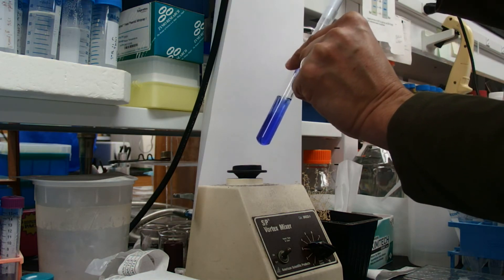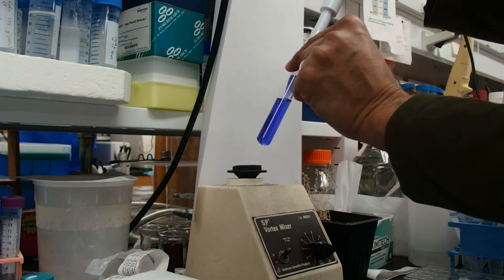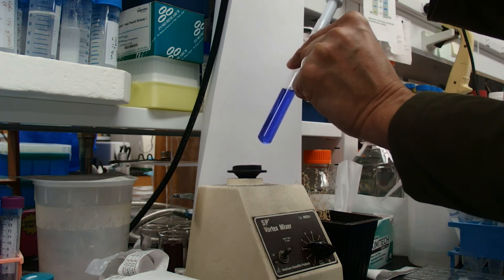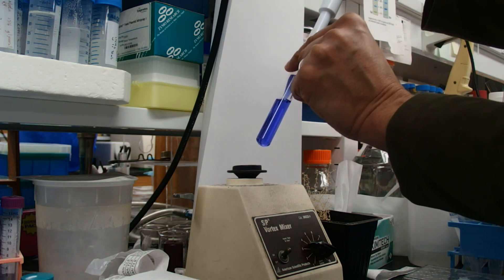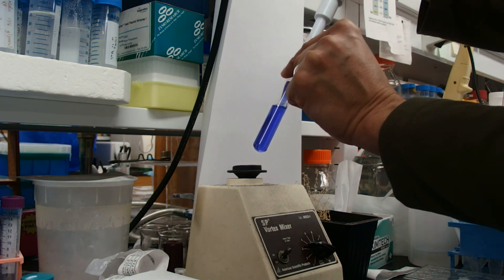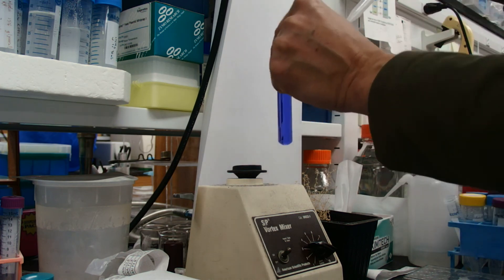We'll repeat that action five or six times. And we have a well-mixed solution.